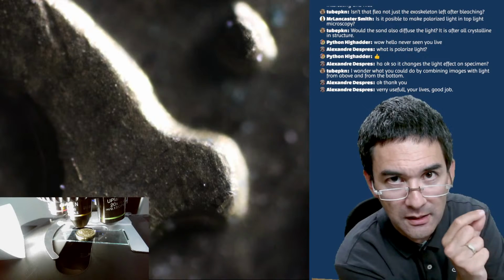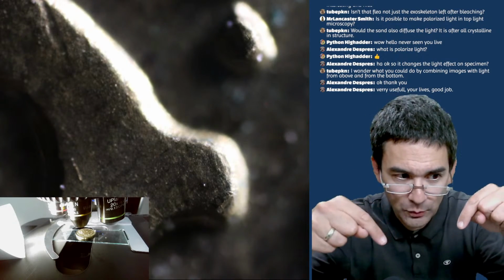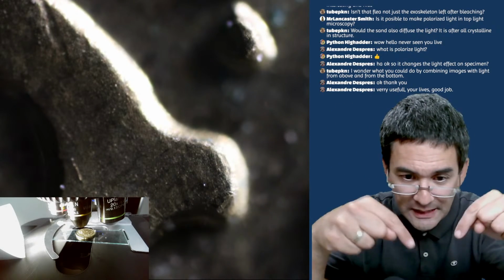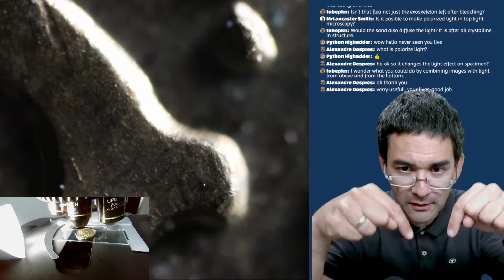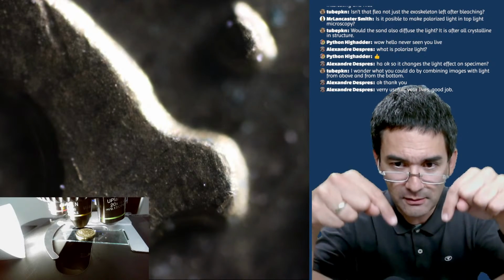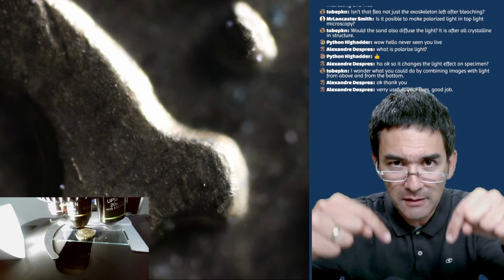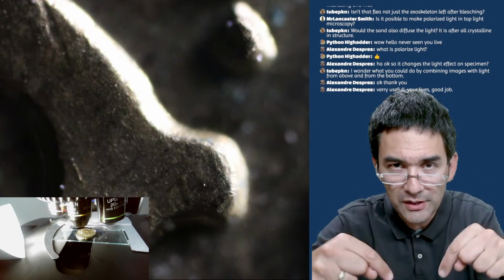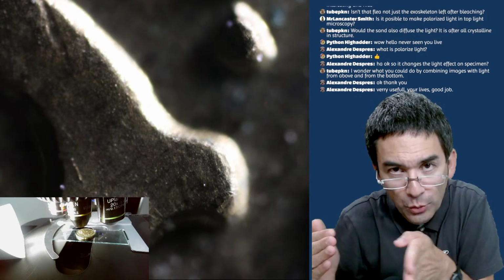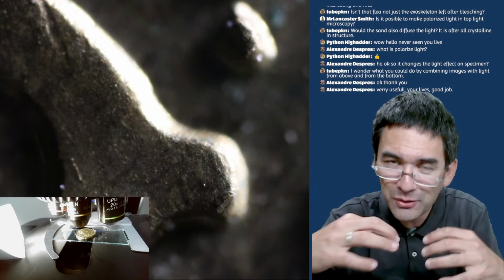Because in a stereo microscope, what you have is the following. You have two objectives, one for the left eye, one for the right eye, and they're arranged in a slight angle. And when you focus, it goes up and down, yeah. But the axis is in the center. And this basically means that when you focus using a stereo microscope and take a picture through one of the objectives, there's also a horizontal shift, which you don't have here. And the software has to take this away.